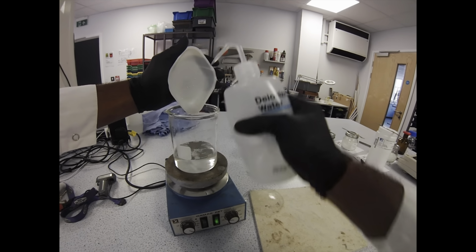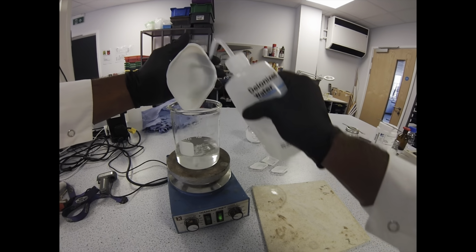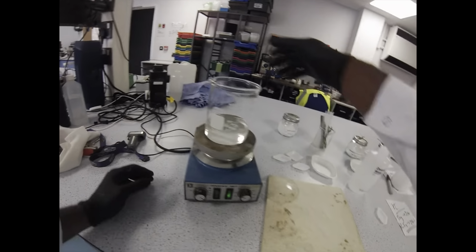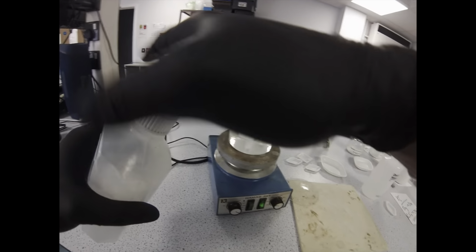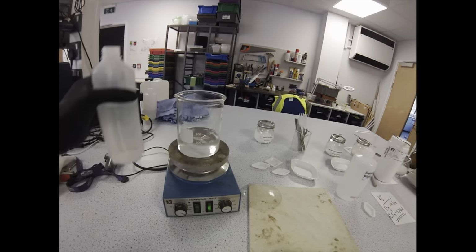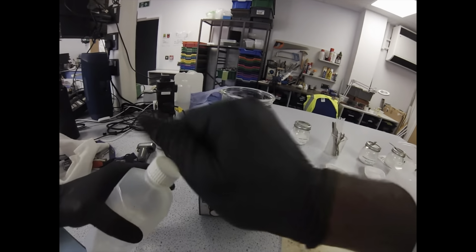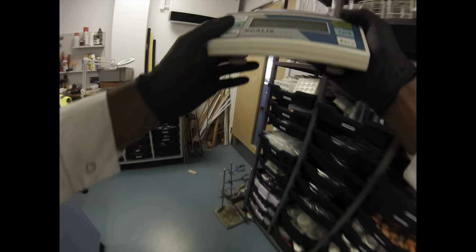Once we've done that and we've rinsed our weighing boat dry, we can start working on our liquid component of this reaction. Just being mindful of that final volume at 250. Just want to make sure that we don't overfill it with the water and make sure we leave enough room to top up to the line when we're ready. Alright, so just time for a quick clear up and then we'll get to the liquids.